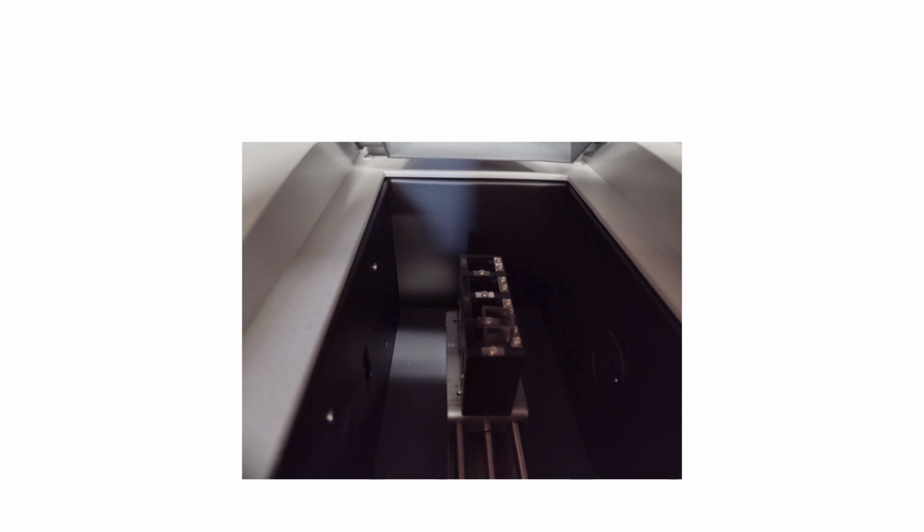So the whole idea behind using a spectrophotometer, it's an indirect way of counting the microbial growth. But you have to correlate the numbers that you're going to get from this machine with, okay, great, I got this number. What does it mean? Correlate it with the number of bacteria. And how do you do that? With whatever media you're using, you're going to have to run one run through to come up with this correlation or this formula.